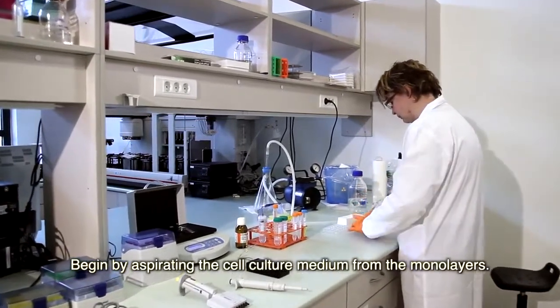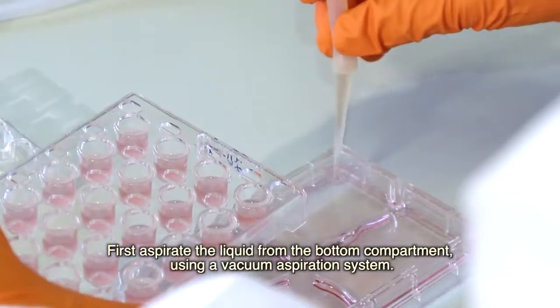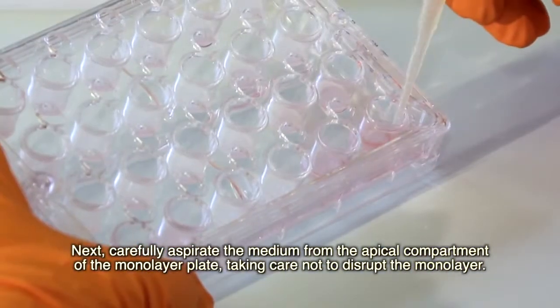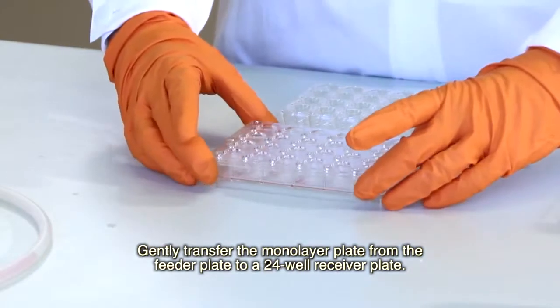Begin by aspirating the cell culture medium from the monolayers. First, aspirate the liquid from the bottom compartment using a vacuum aspiration system. Next, carefully aspirate the medium from the apical compartment of the monolayer plate, taking care not to disrupt the monolayer. Gently transfer the monolayer plate from the feeder plate to a 24-well receiver plate.